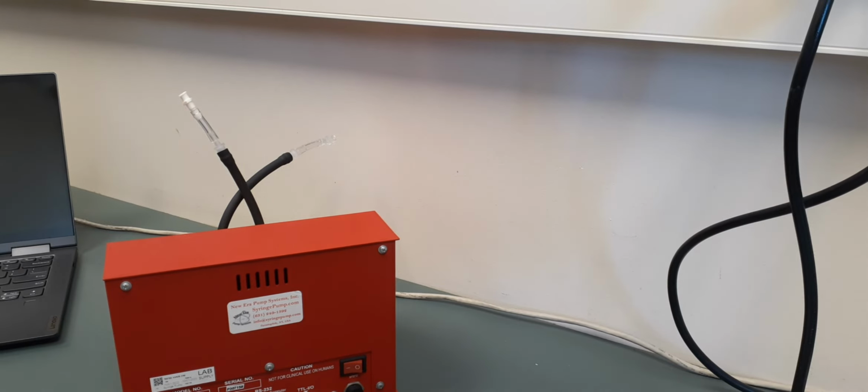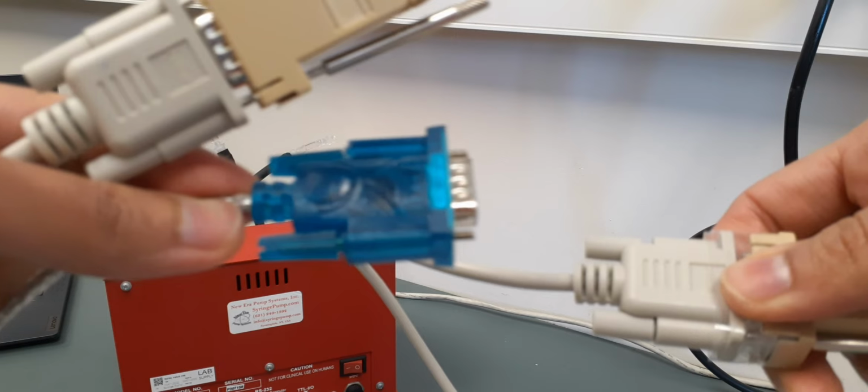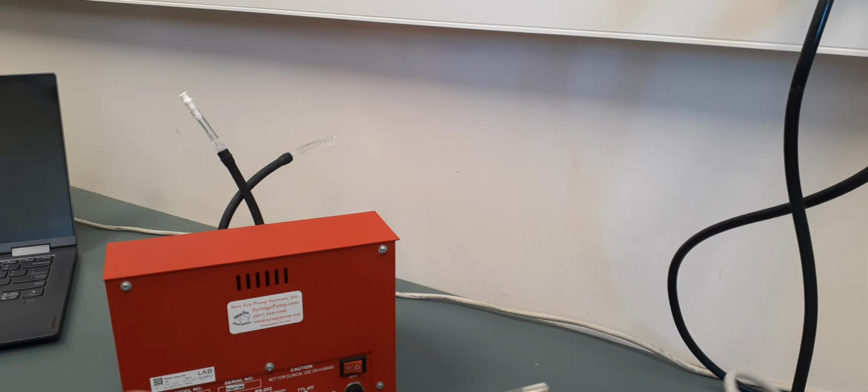And then the end of that one will sit to this cable. And then I'll show you how to do it. So let's just see the whole setup. How does it look?